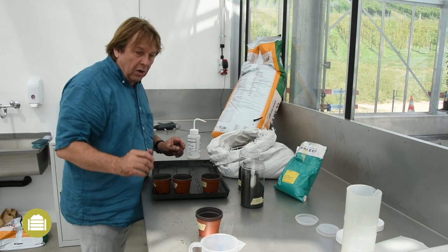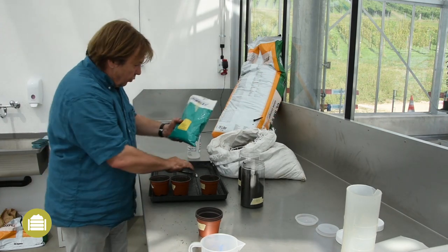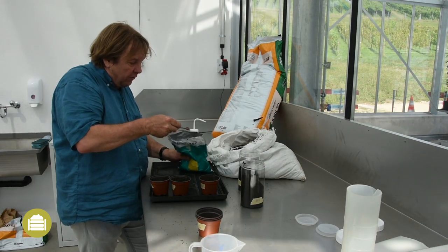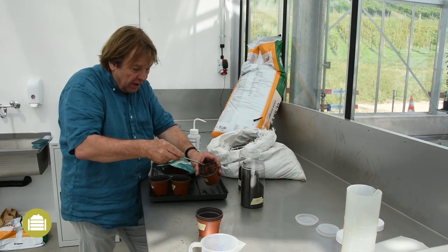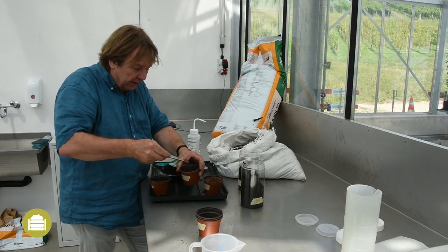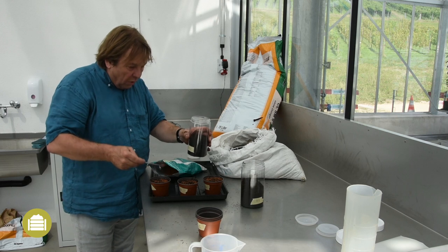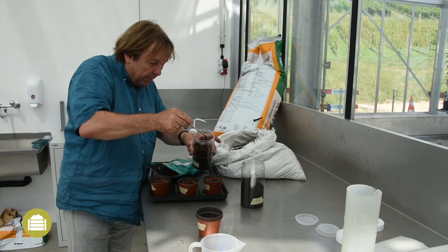Then I add approximately one gram of cress seeds to each pot. I do not weigh the seeds but I use a calibrated spoon. I distribute the seeds over the entire surface of the pot. For the closed test I also add one gram of cress seeds. It is important that the seeds are placed along the edge because I will measure the root length in this test.